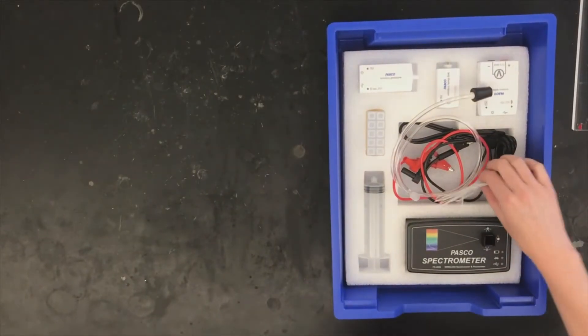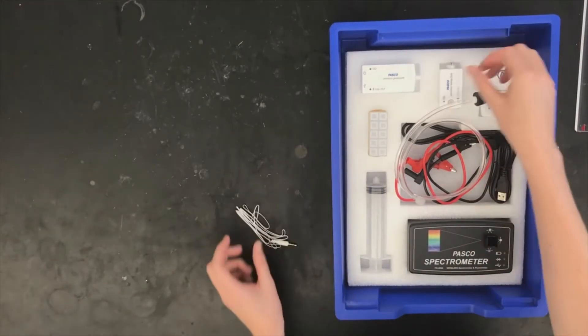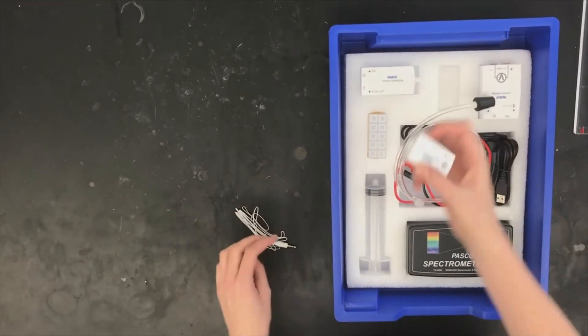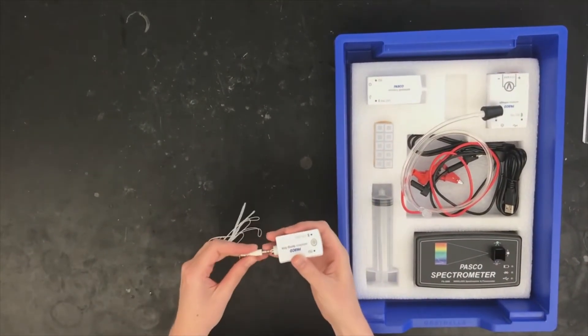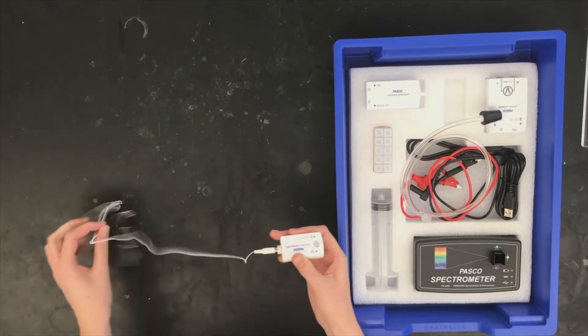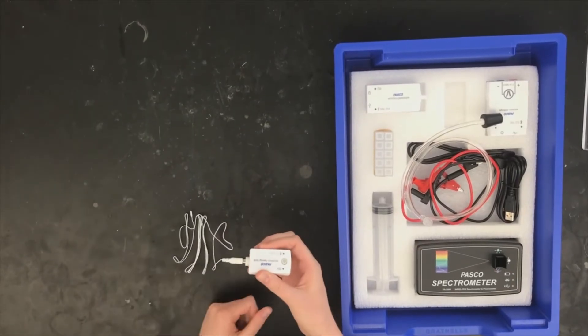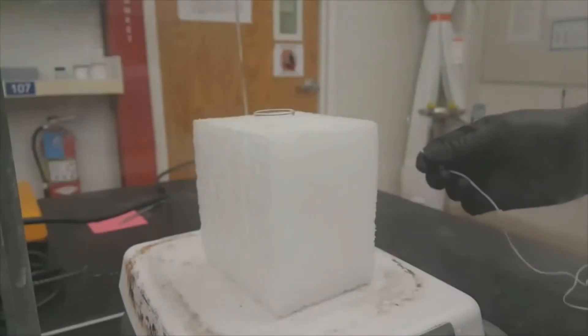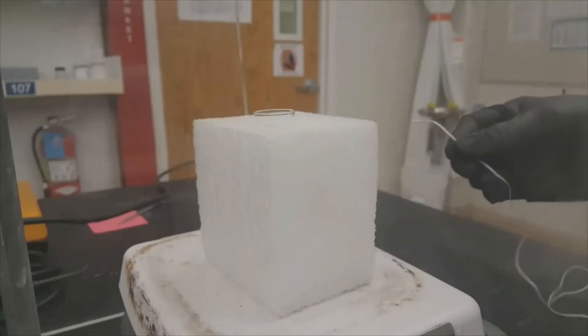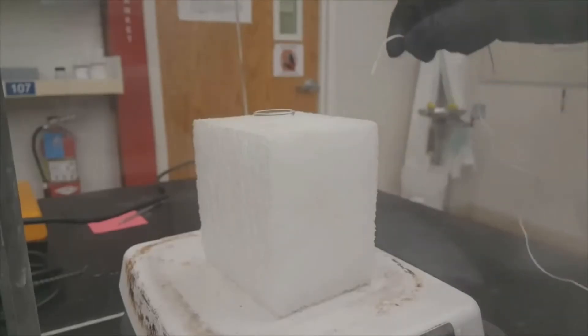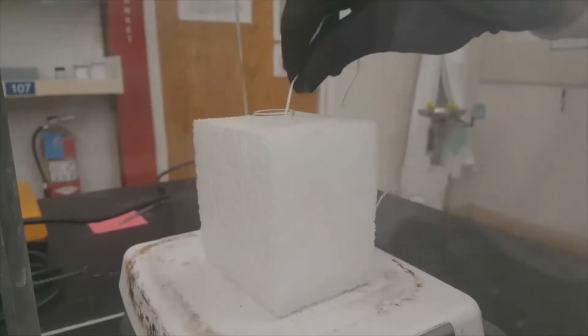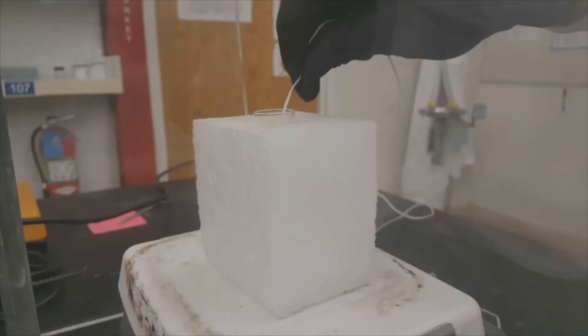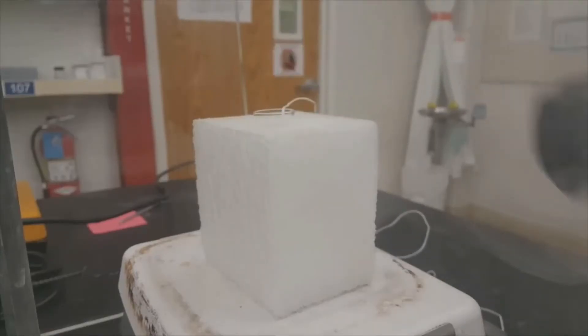Today you'll be using the temperature sensor. Get out the temperature sensor that looks like a white shoelace and plug it into the wireless temperature link. After you've got this set up, you're going to put the thermometer, your fast response temperature sensor, into the vial and above the stir bar. You can go ahead and check using your adjustments that the bar is stirring appropriately and then you'll be able to add your solutions into this system.